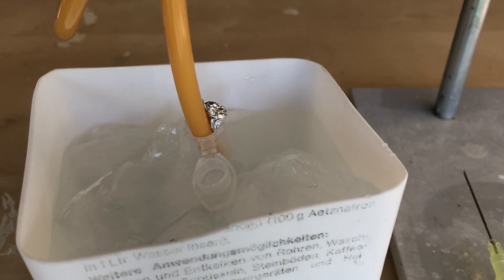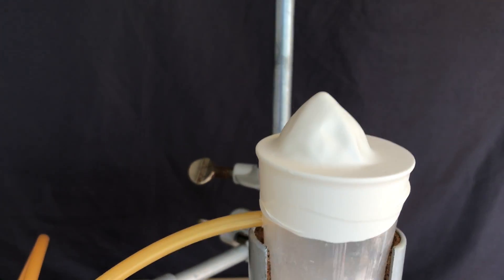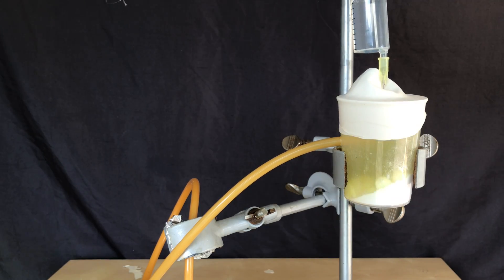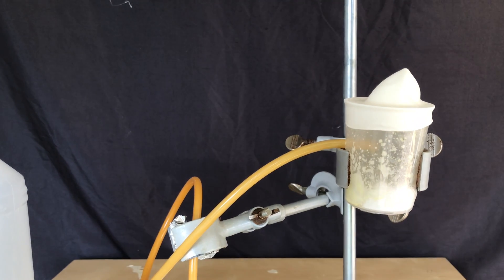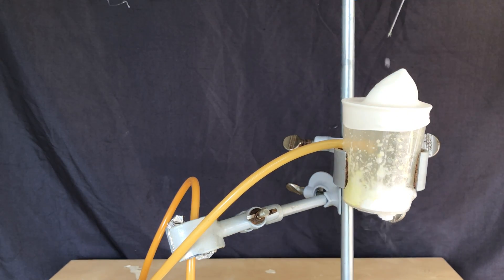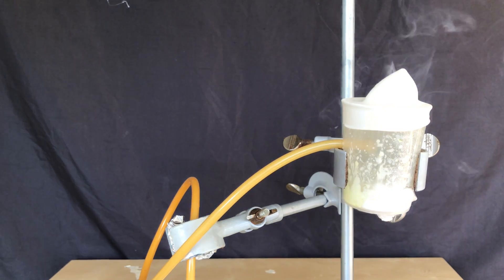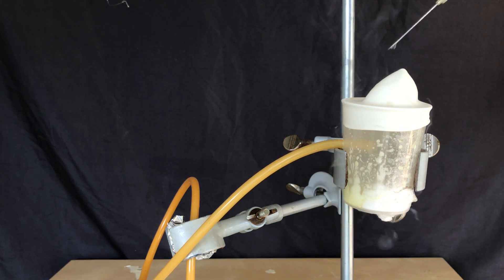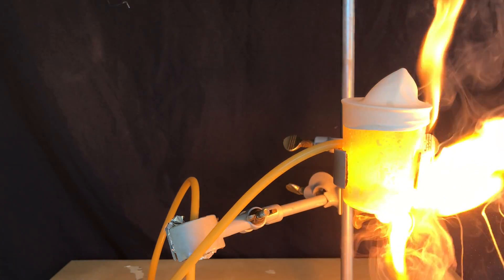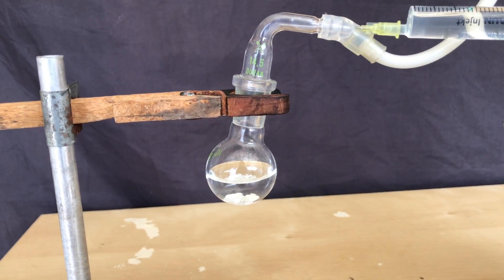Even more interesting than chlorine dioxide solution is liquefied chlorine dioxide gas. I set up a contraption made out of plastic — if it shattered there wouldn't be glass shards everywhere — but it failed. The first time it popped off the balloon, and apparently the container was also damaged because the second time it started to smoke and then do something else. As it turns out, plastic might not have been the best option.